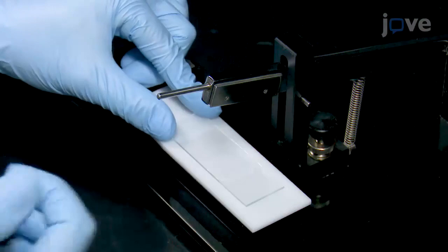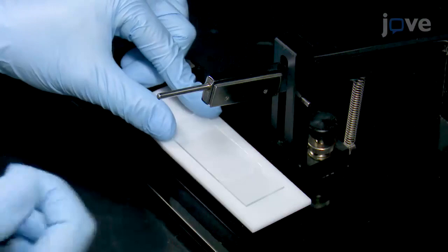Next, place the slicing chamber on the stage of the tissue slicer. Center it horizontally on the stage and mark the long edge with permanent marker for alignment. Then load a piece of blade onto the slicer arm and secure the blade.